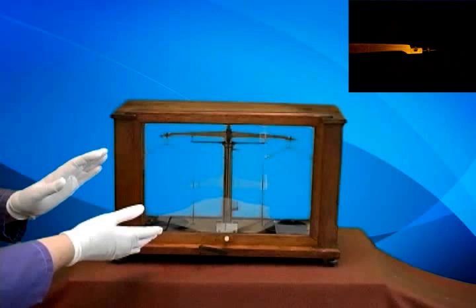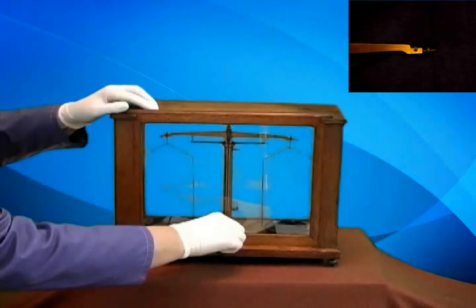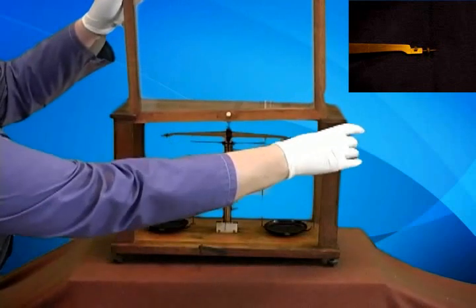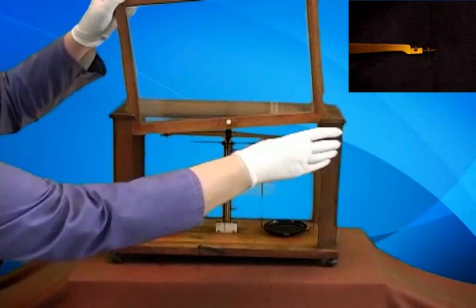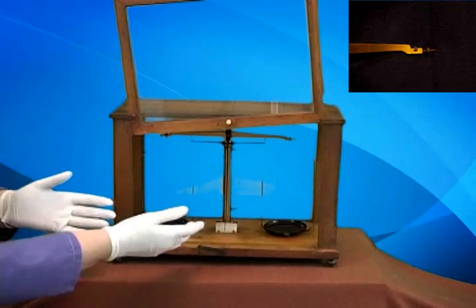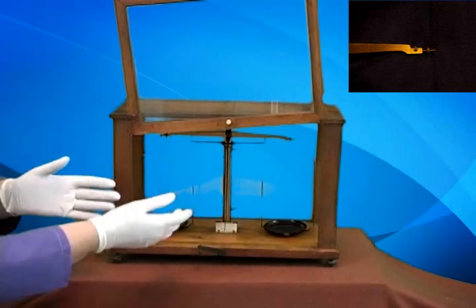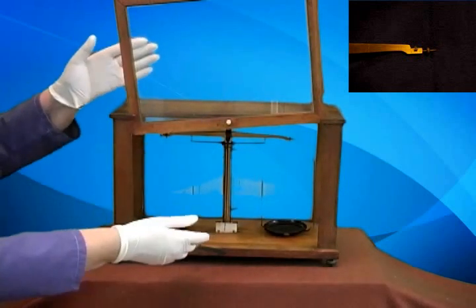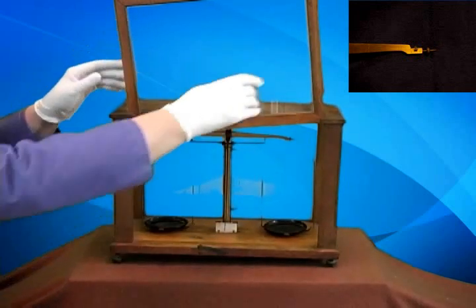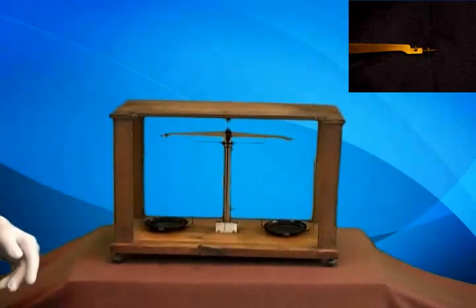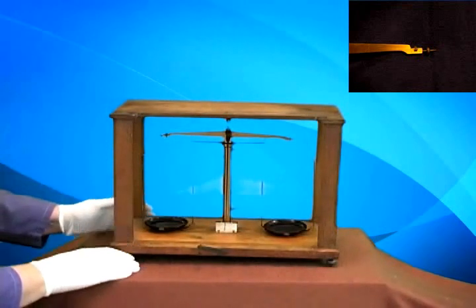How would the chemist work in here? Well, they would open this and there was a latch here that would hold the window open while they were adding weights or adding materials to the balance. And then the lever could be pressed and the window lowered again. But for our purposes, I'm going to remove the window so that I don't have to worry about hitting it or something of that type.